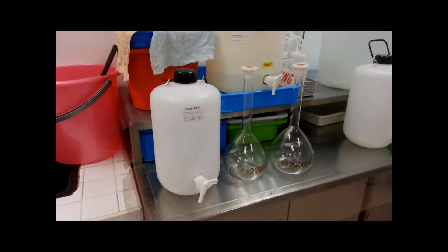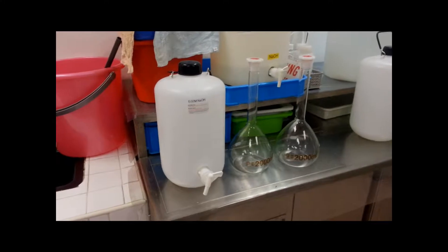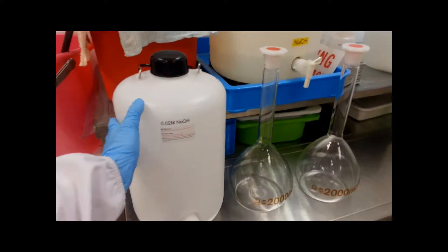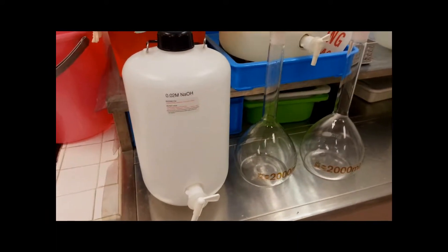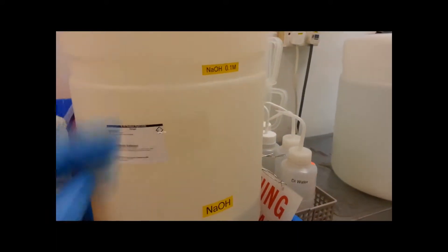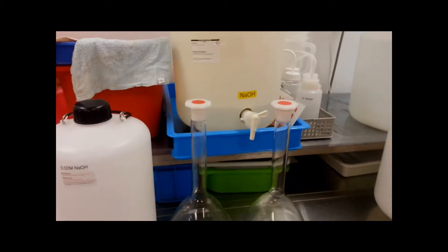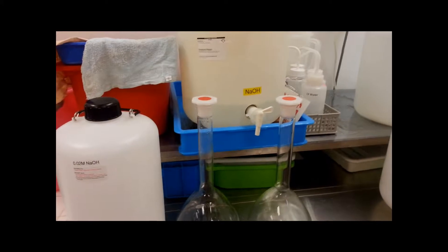Preparation of reactants sodium hydroxide. Firstly, prepare 4 liters of 0.02 molar of NaOH using 0.1 molar of NaOH solution. To achieve that, 800 ml of 0.1 molar NaOH solution is required.